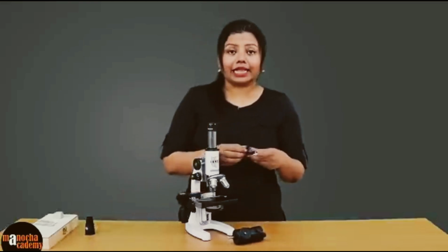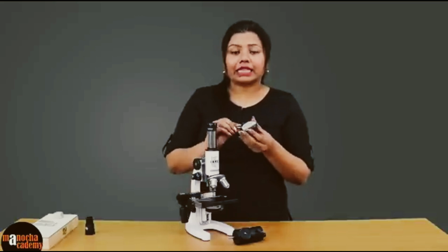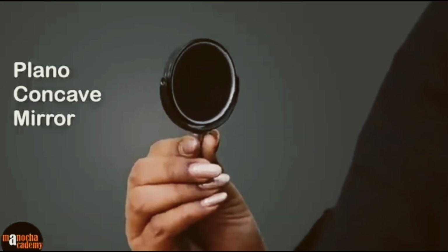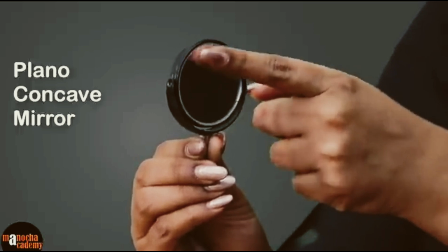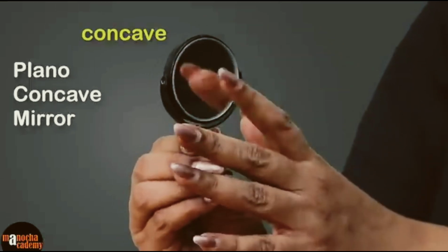However, you might have seen a microscope in the laboratory where a mirror is usually used. This mirror that we use is a plano-concave mirror, which means that one side of the mirror is plane, that is straight, and the other side is concave.